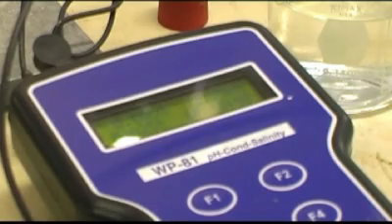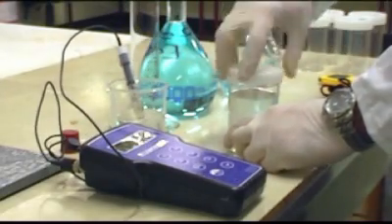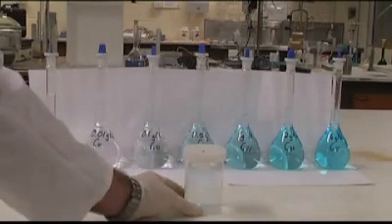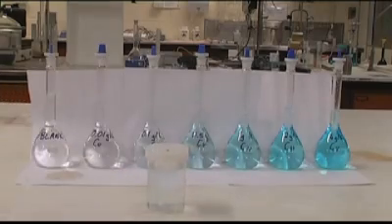Now we're measuring and recording the pH of the extracted aqueous phase. We're also using eye colourimetry to determine the copper ion concentration remaining in the aqueous layer. It'll make more sense later.